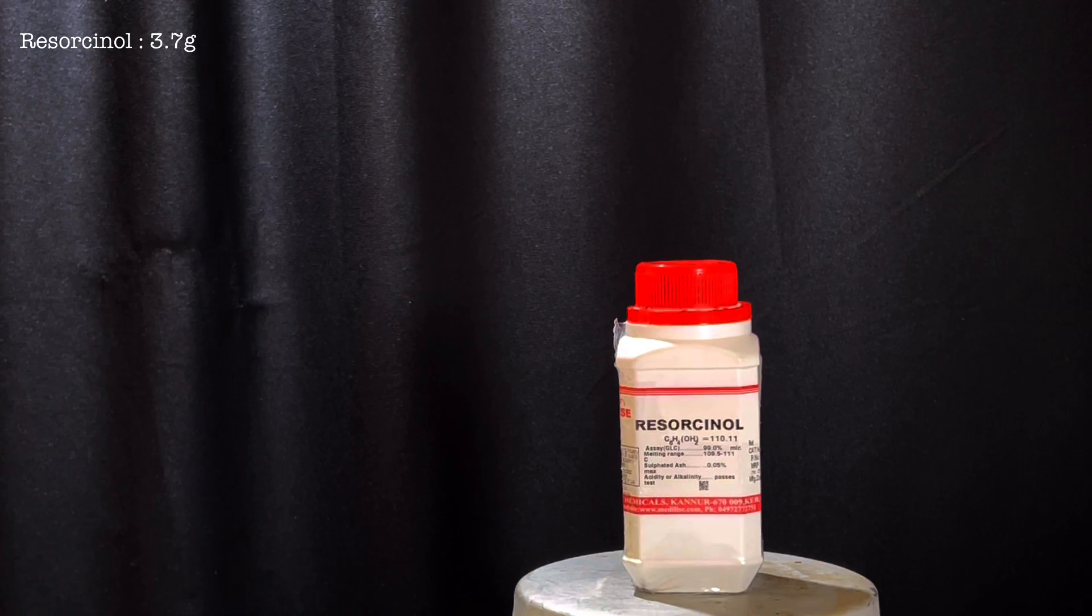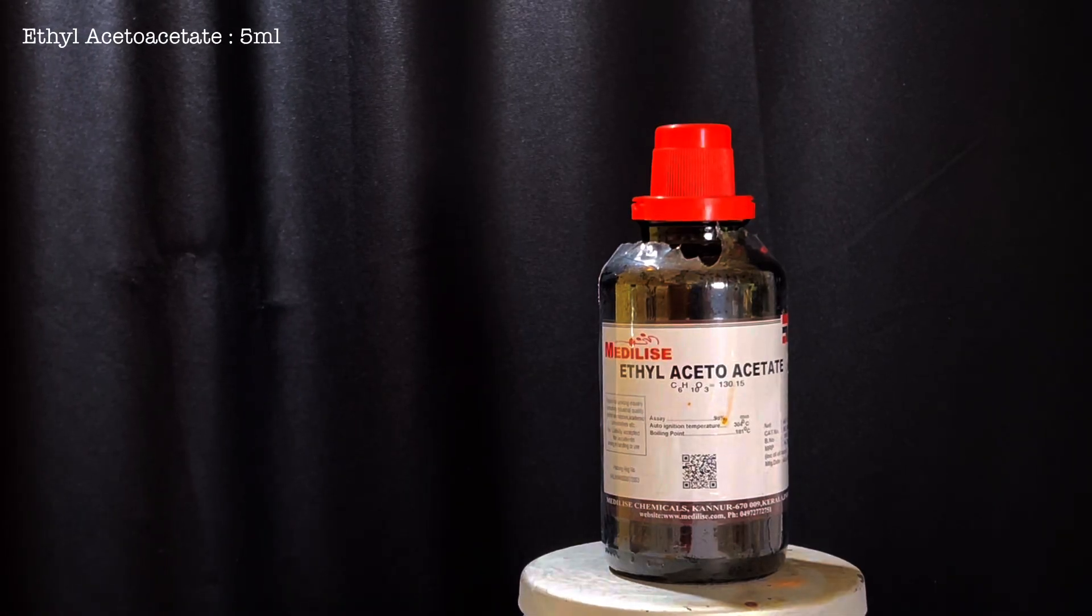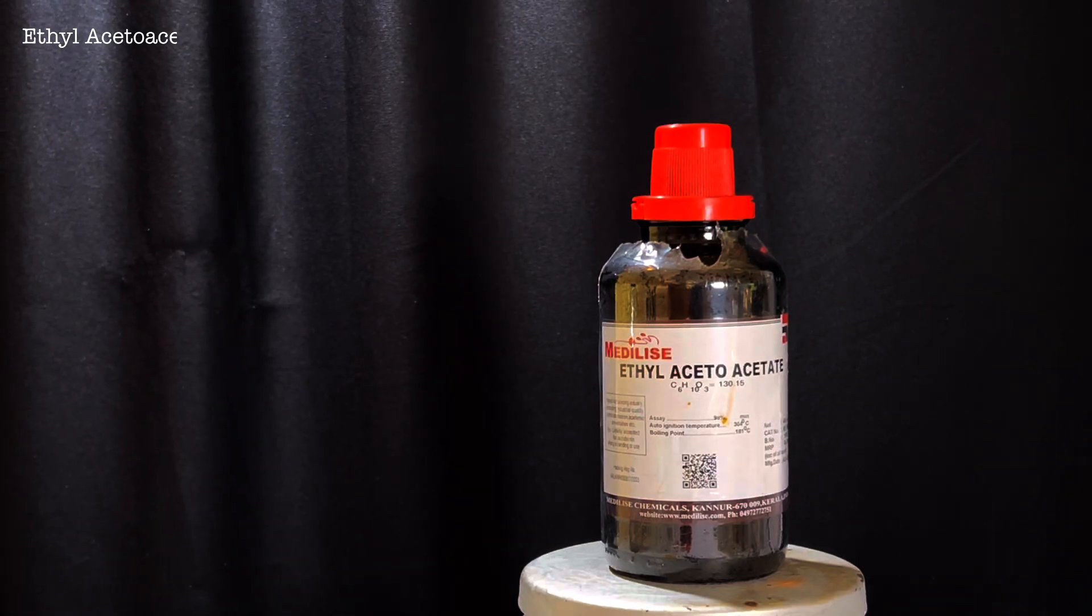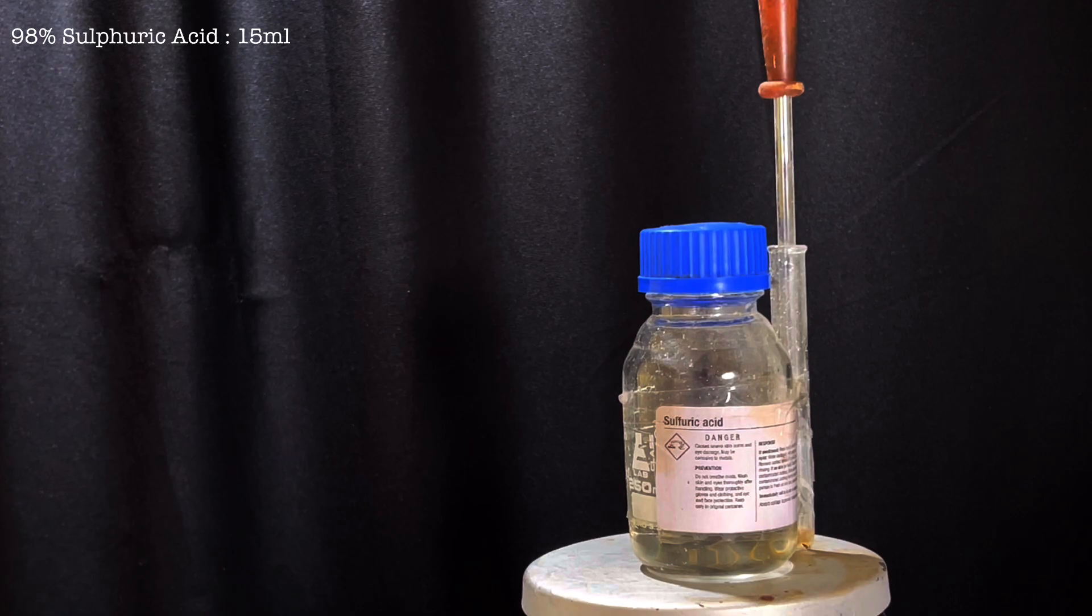For this synthesis you will need 3.7 grams of resorcinol, 5 ml ethyl acetoacetate, and 15 ml of 98% concentrated sulfuric acid.